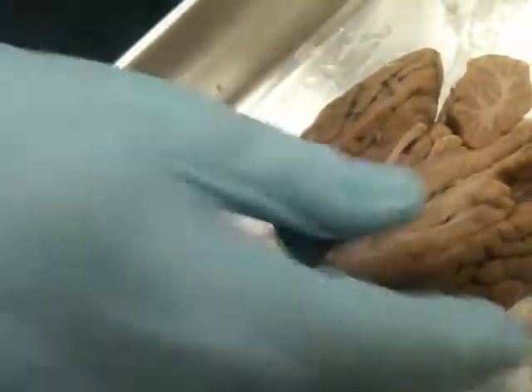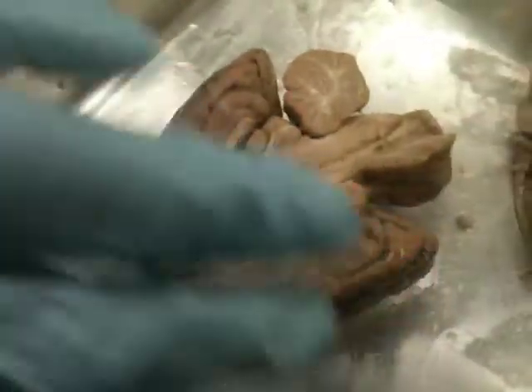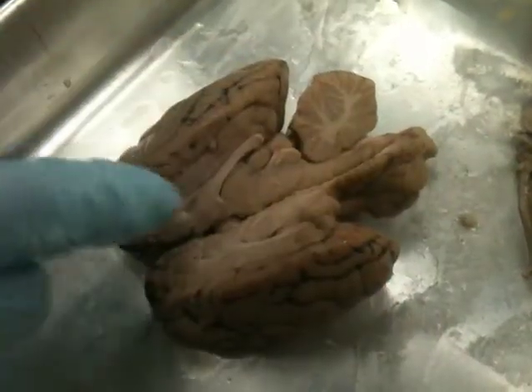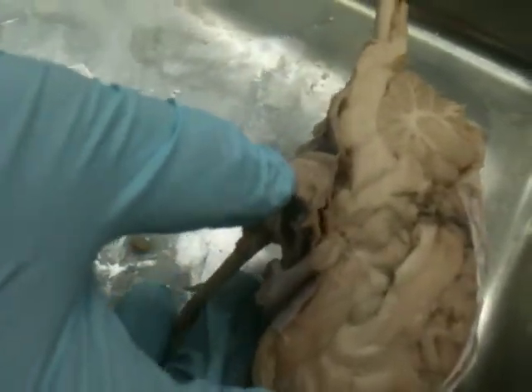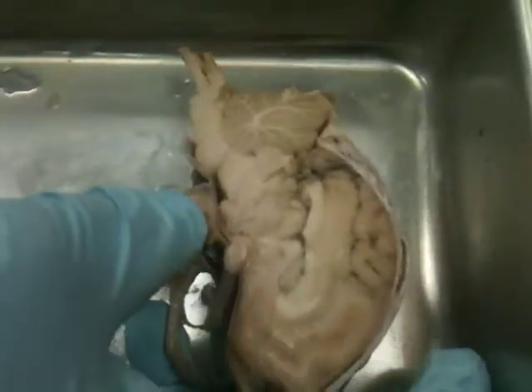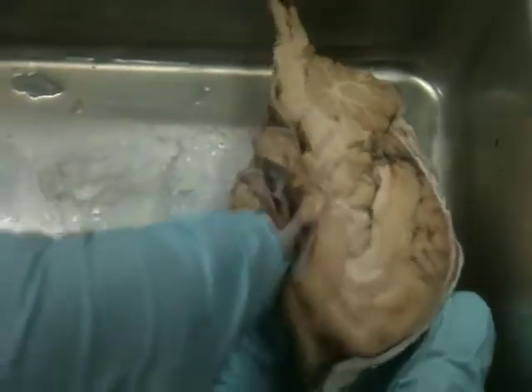Okay, and then usually behind the optic chiasma here, you would have the pituitary gland, but it's really just held in by the meninges. So since the meninges are absent on this one, we lost the pituitary, but on this one you can see it. See this coming off? See, that's the pituitary. Okay. Yeah, so it's behind, here's the optic chiasma, it's just posterior to it. It's bigger than I thought it would be. This thing right here is the optic chiasma, and that's the pituitary. Yeah, it's a really big projection coming off, and it's really just held in by the meninges.